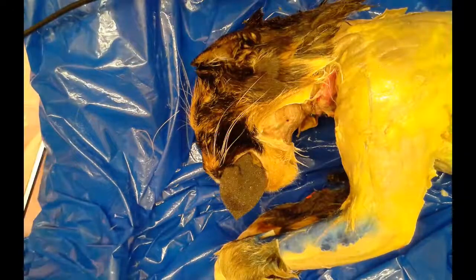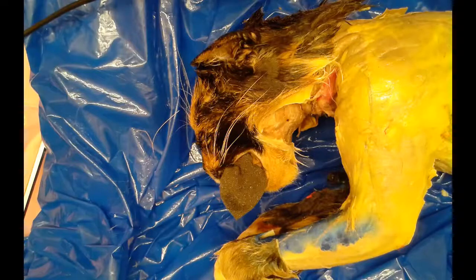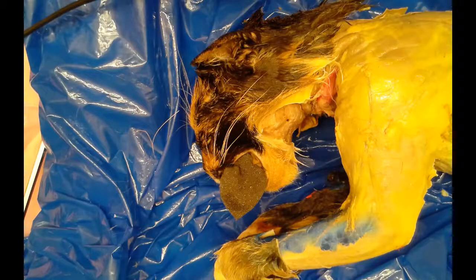Hey guys, we are starting our cat dissection and today we're going to be focusing on the external anatomy.